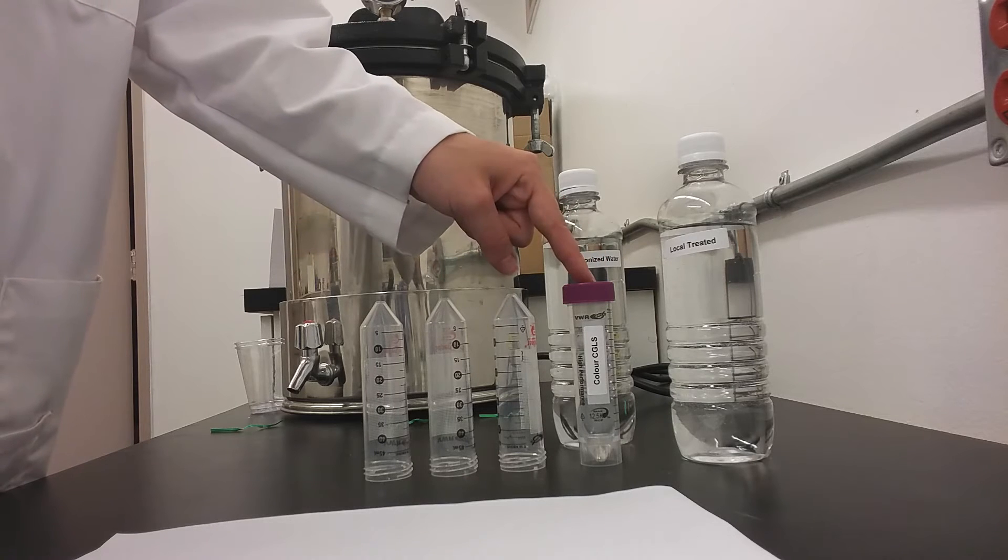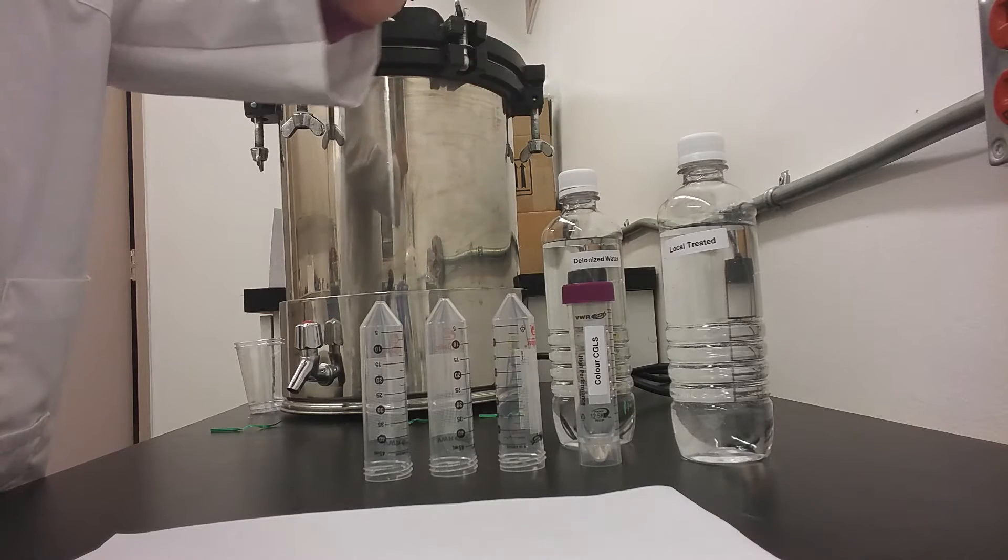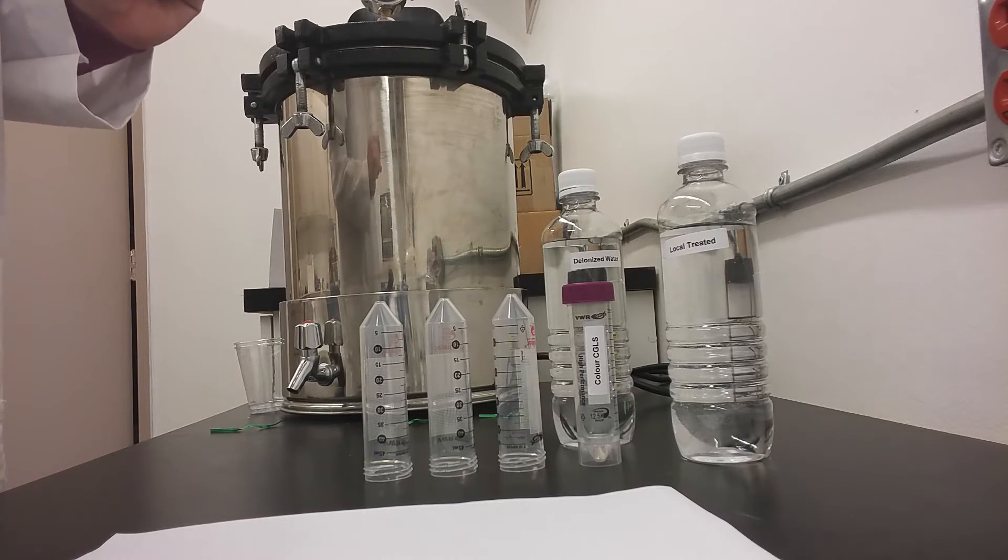a beaker for your Canadian guideline sample that is included in the test, and a beaker for however many treated sources you are choosing to use.